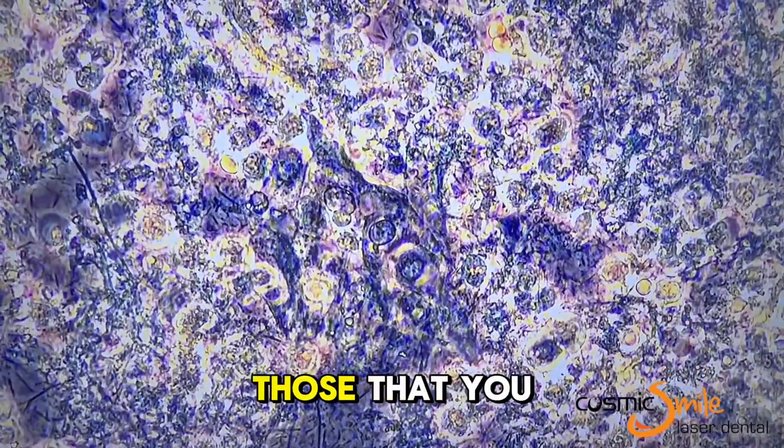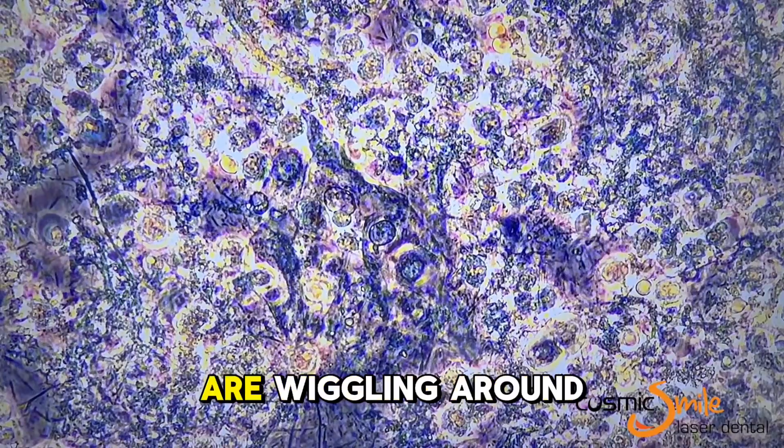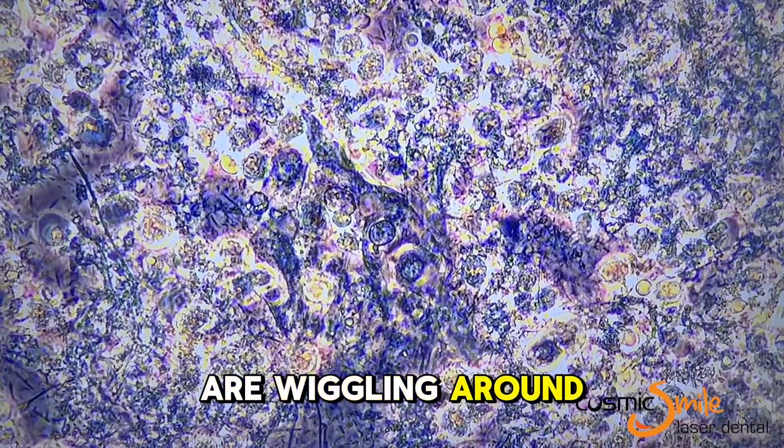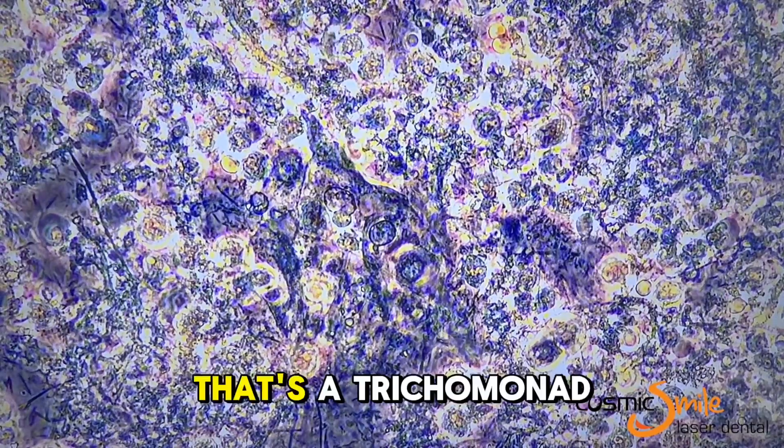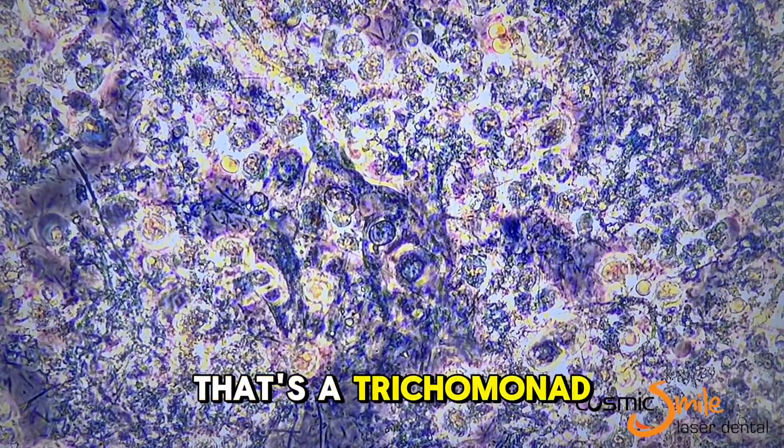Any of those that you can see wiggling around like that — that's a trichomonad.